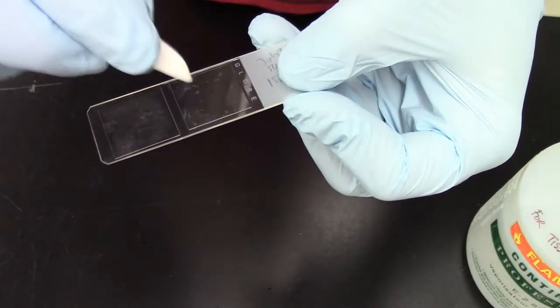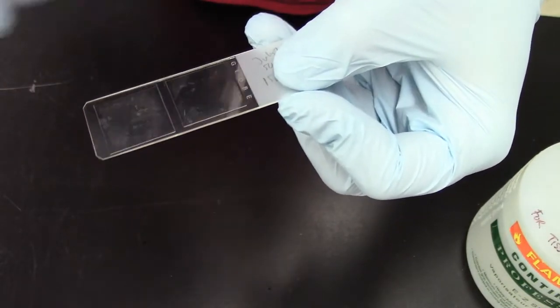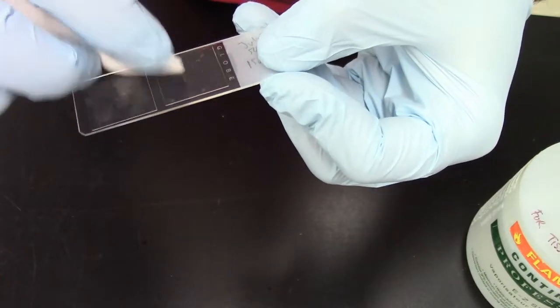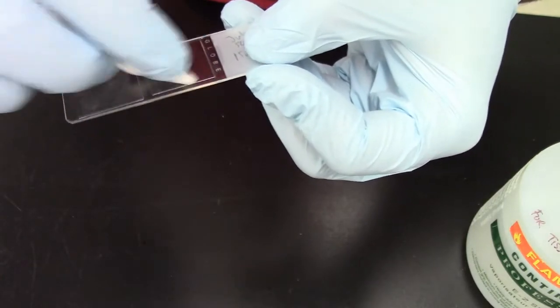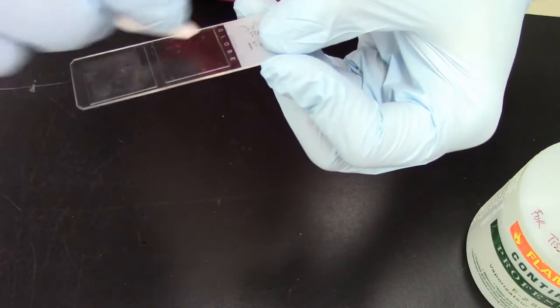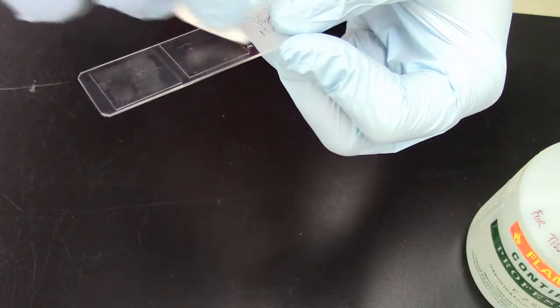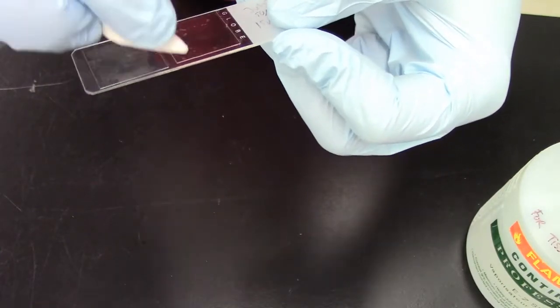And right away you can see that wherever I cleaned it, it is nice and clean. So you do not press on it, you do it very gently. The idea is to remove this haze and if you wonder what this haze is, basically it is dried up media or dried up reagents from the staining. Basically stuff we do not want.